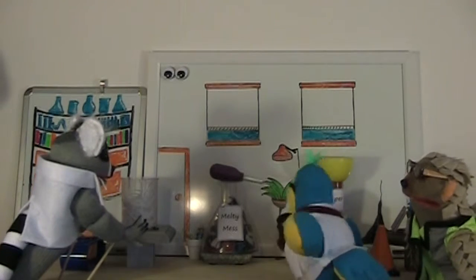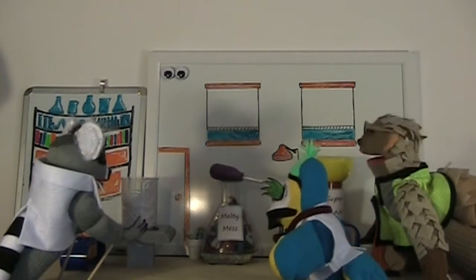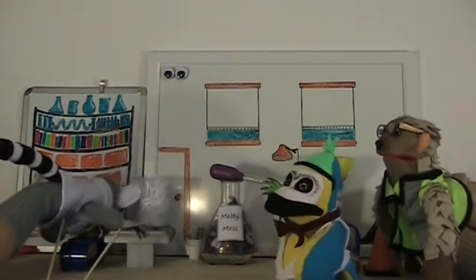Wow, that's really strong orange juice. It smells like acid. Oh, it was acid. Here's the orange juice. No! No! What? You said I couldn't have it. Get the noodles! Why? You know what? In my head, it sounded wrong, and then it was.